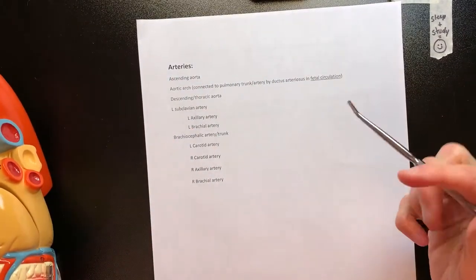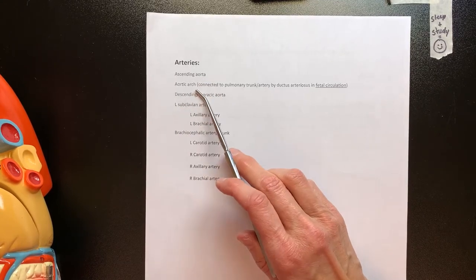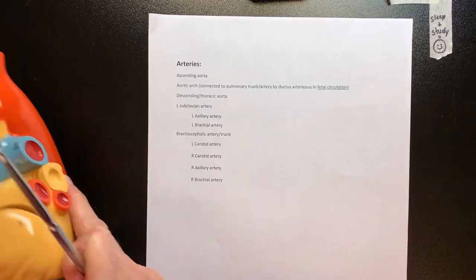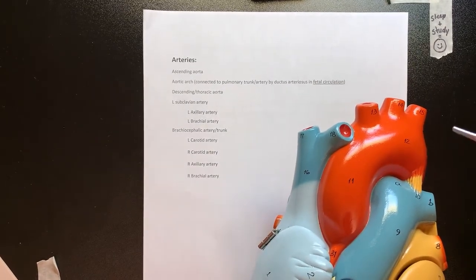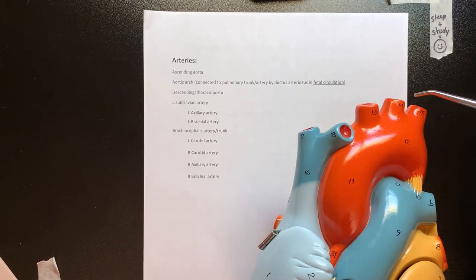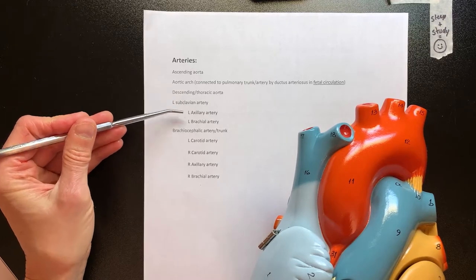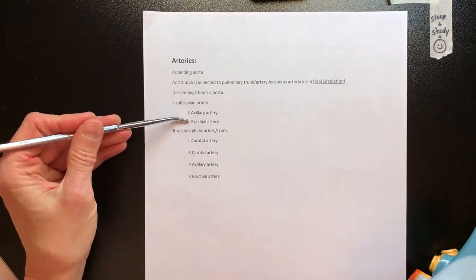The aorta goes up as the ascending, then there's the aortic arch, and then the descending or thoracic aorta. There are some branches off the aorta at the top. In a fetal pig, you'll only see two branches — the middle one will be gone. The first branch is the left subclavian artery, which will have a left axillary and a left brachial artery branch.